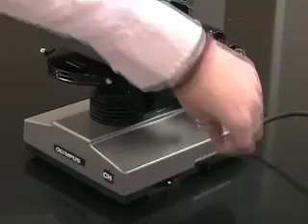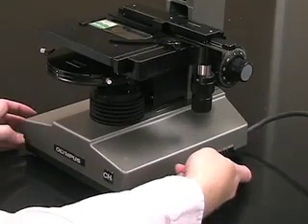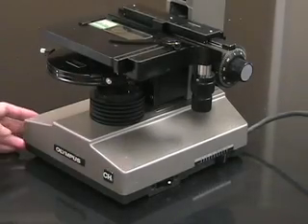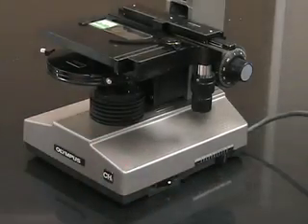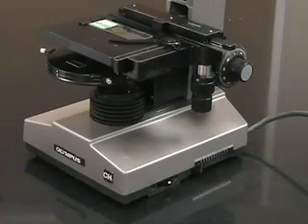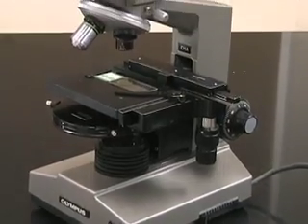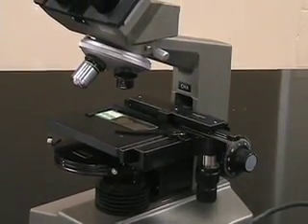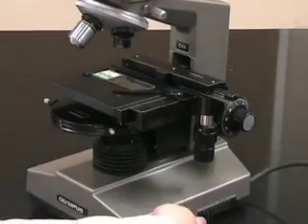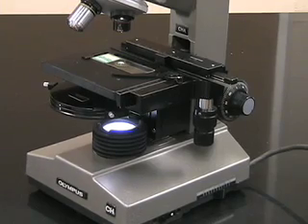You also want to check this sliding switch, which controls the amount of light coming through the light source. If it's turned way up to maximum light and you look through the ocular lenses when you turn on the scope, you might actually hurt your eyes. So you want to start with it on the lowest setting. After ensuring the shortest objective lens is pointing down and the light is at its lowest, you can turn the scope on and slowly move the slider up until you see a low amount of light coming through.